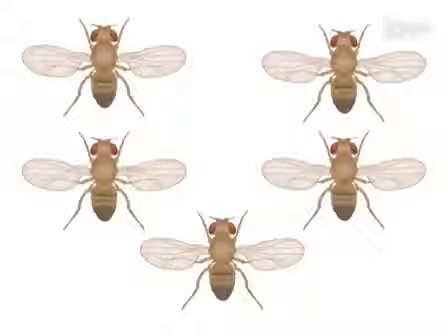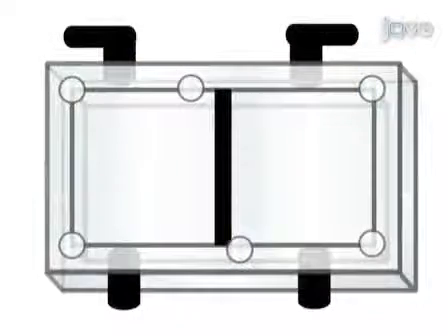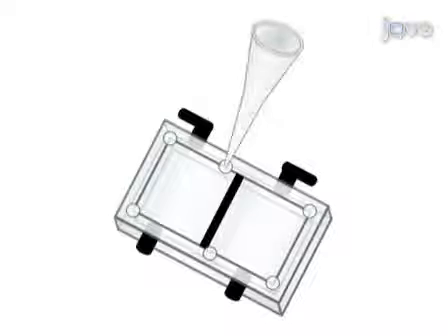In the video tracking assay, flies must be loaded into a square observation chamber without the use of anesthesia. To do this, a small funnel must be lined up with screw holes in the chamber so as to knock the flies into the chamber using this funnel.